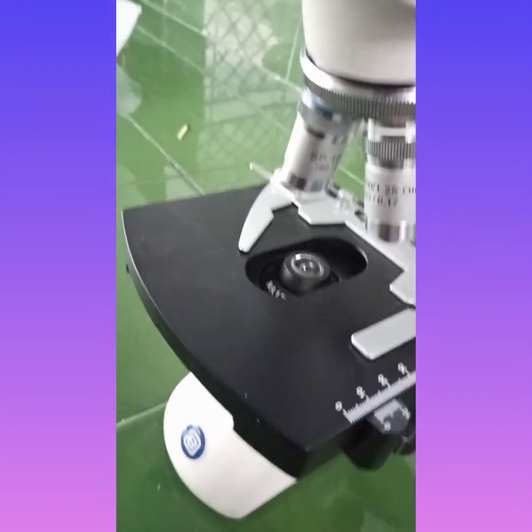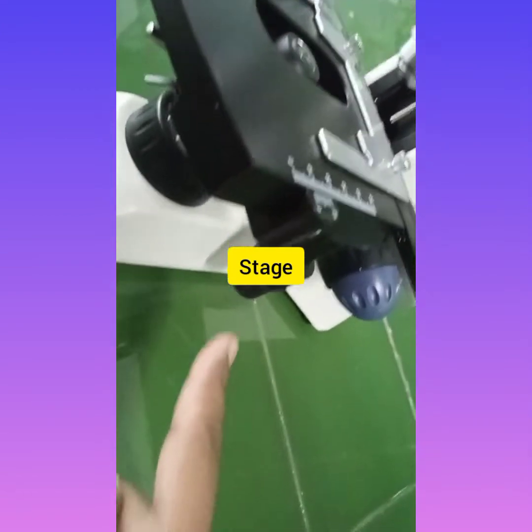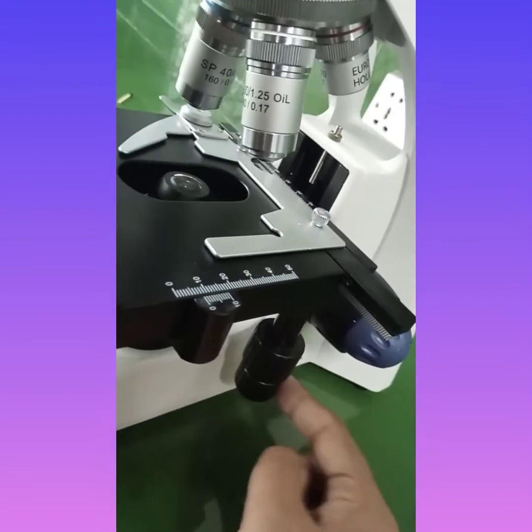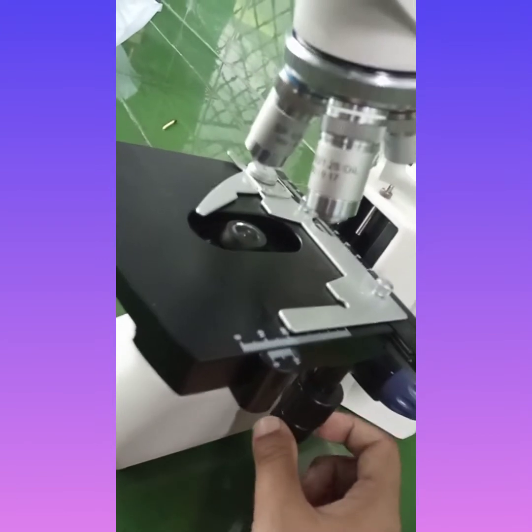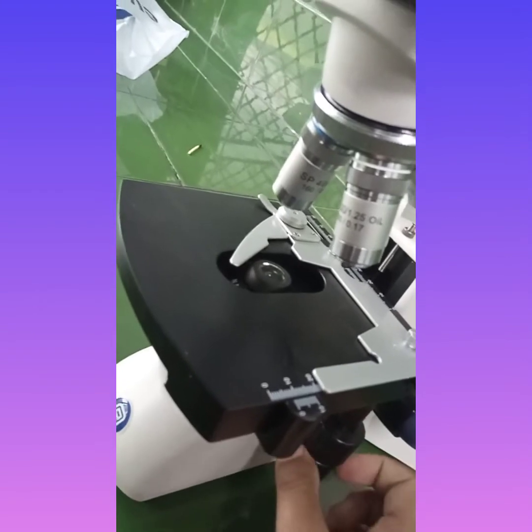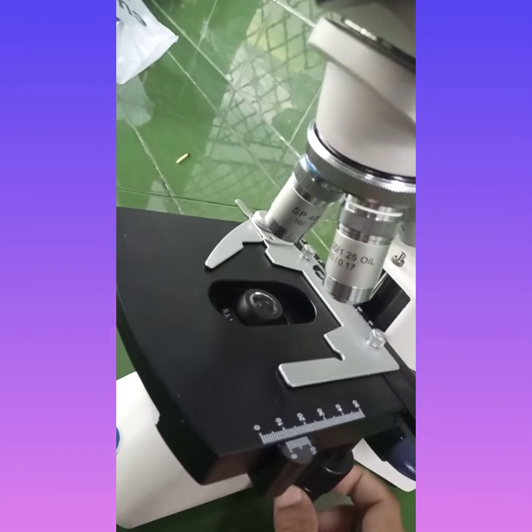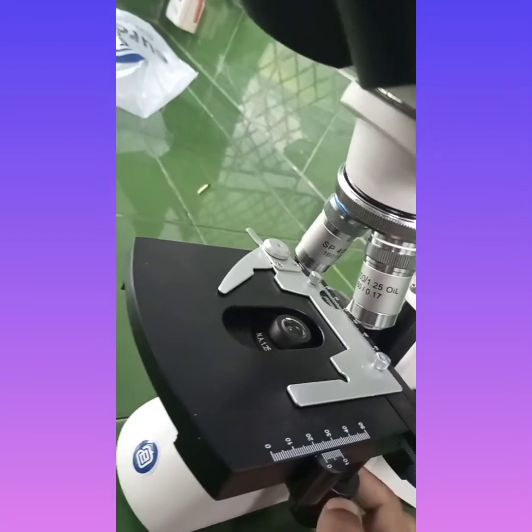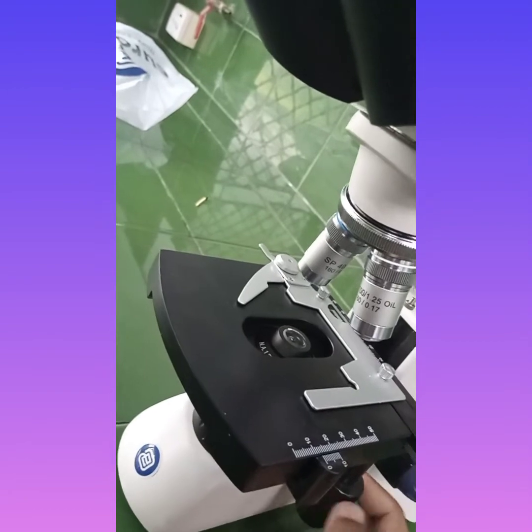This is the stage of the microscope. On this stage we will be placing our slide to observe the results. Now these wheels are present below the stage, and we will move both of these wheels, which will help to move the stage clips right and left and back and forth. You can see that I am moving the wheel and the stage clips are moving right and left. Now when we move the second wheel, it will help to move the clip back and forth. You can see it is moving in the forward and reverse direction.